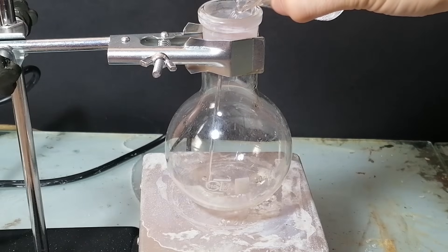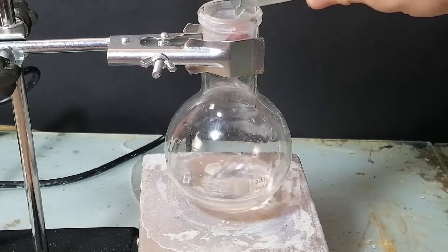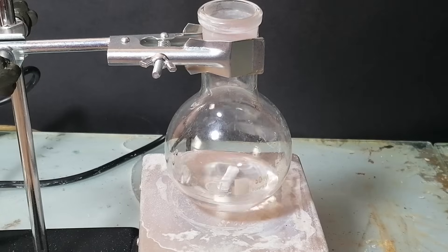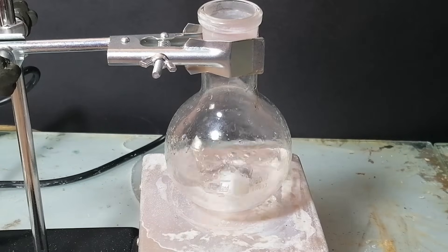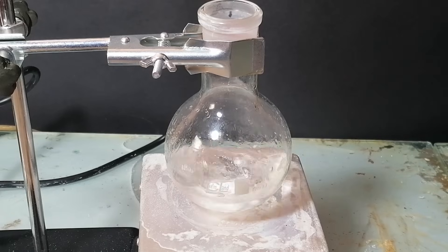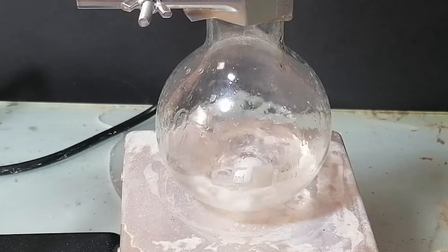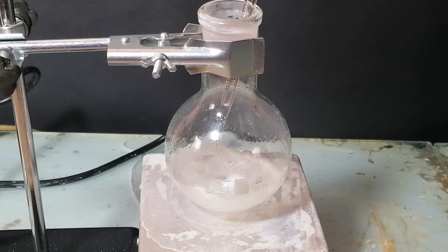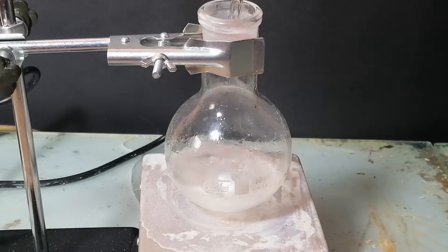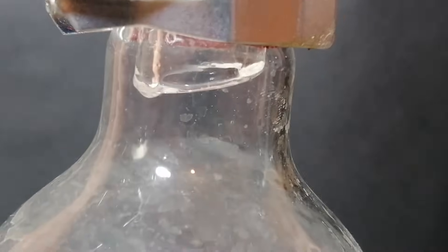To a 250ml boiling flask, I've added all the glacial acetic acid, then around 60ml of isoamyl alcohol, and finally a stir bar. Now technically, if organic chemistry wasn't dark magic, we would technically just add these and wait for the isoamyl acetate to appear. However, this is sadly not how organic chemistry works and we're going to need a strong acid catalyst. For that, I've asked my homie sulfuric acid to help, and I've started drop-wise adding 4ml of concentrated sulfuric acid. Now we're ready to start a reflux — a reflux is basically when you boil the solution without the loss of any liquids.